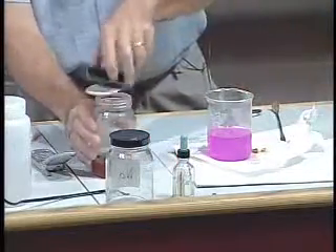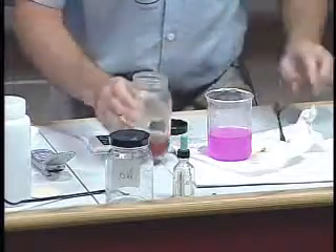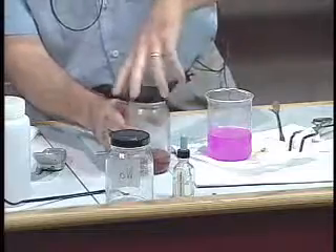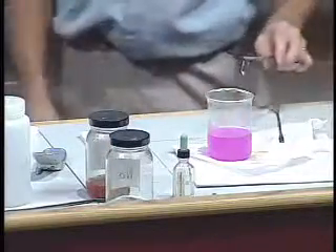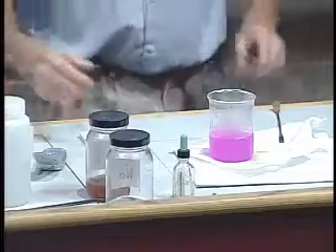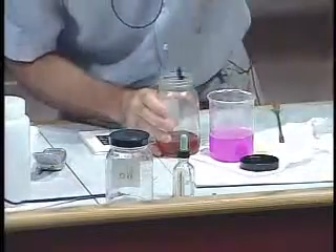Maybe I'll take that big chunk and just put that away. This is a much smaller piece than the piece of sodium that I put in. Instant flame — very much a pinker flame, hotter flame. And the reaction is almost gone. We'll put the bigger piece in. It's a lot more fun, isn't it?